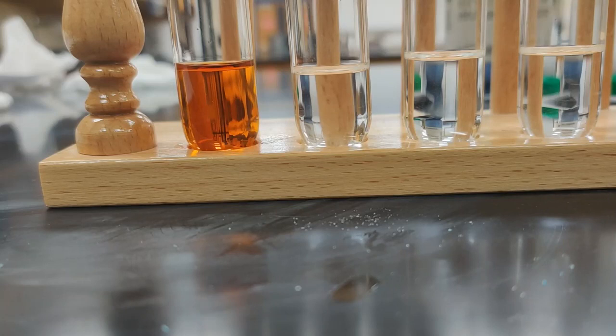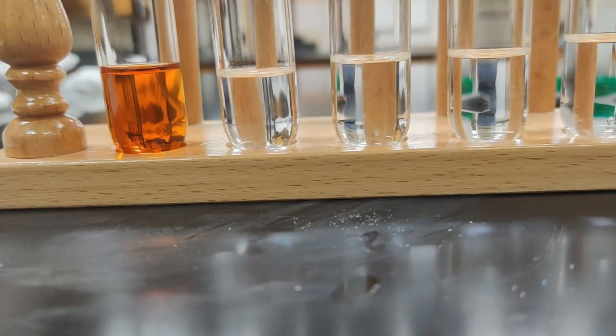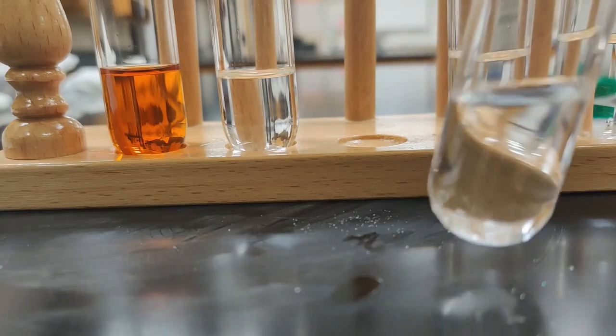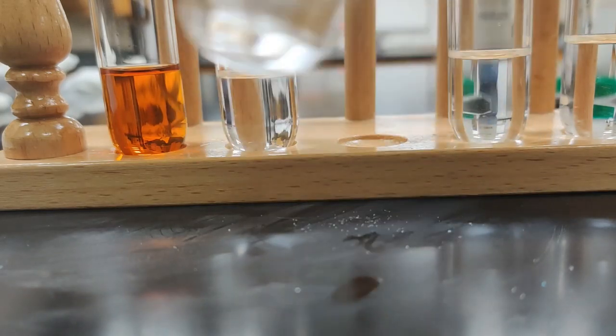So the next thing we're going to try is our naphthalene, and we're going to remember that we might have to look at the top of the solution for this because last time it floated in water. So I'll put in our naphthalene, and again I saw that really just kind of fall through the solution. But again, we do want to give it a fair shake and make sure that we agitate a few times.